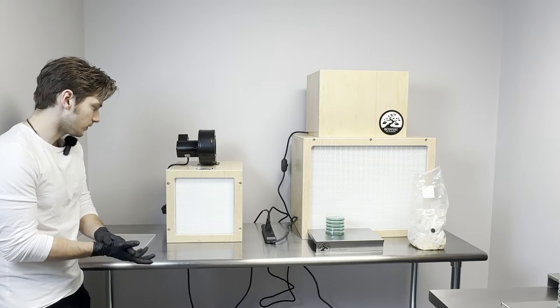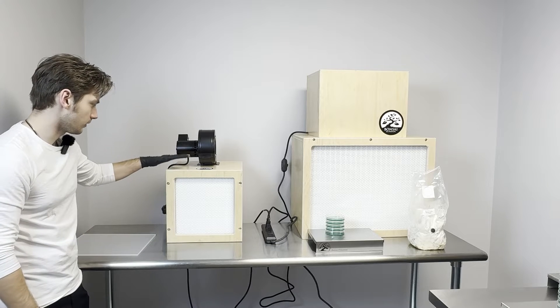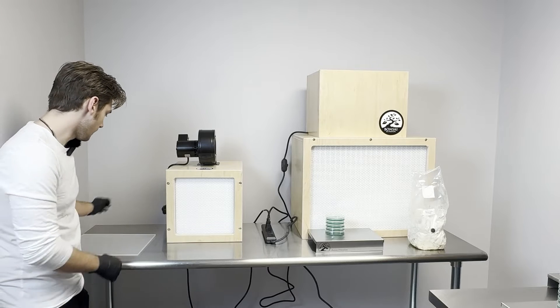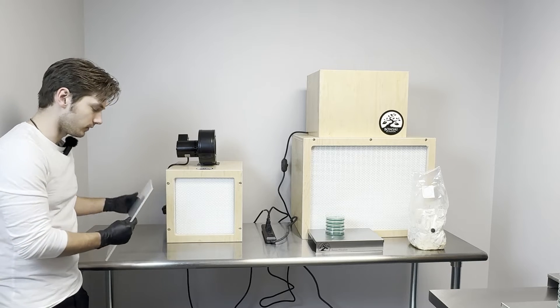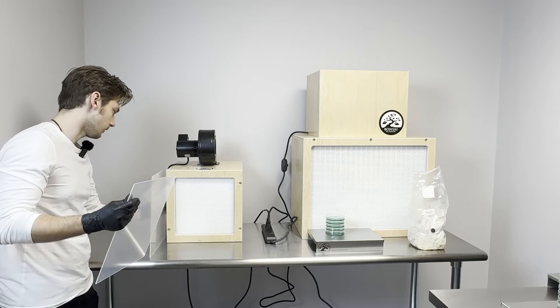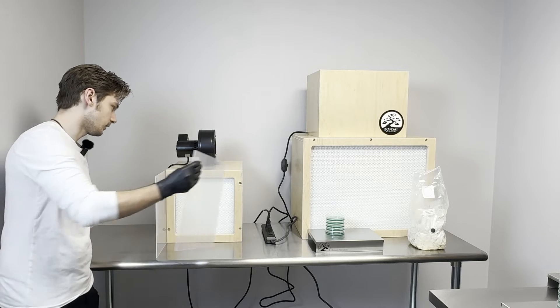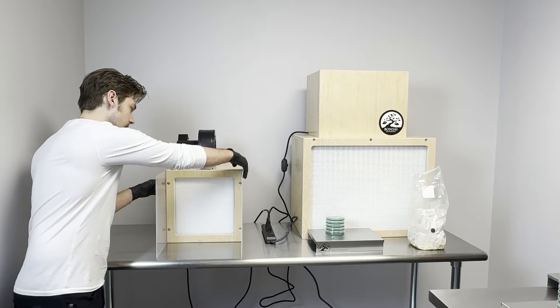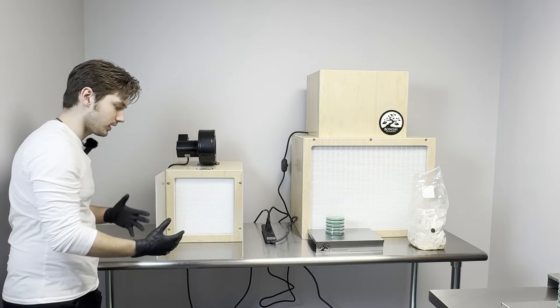If it's your first time using the flow hood, you'll want to go ahead and run it for at least 30 minutes to season the filter. And furthermore, if it's your first time using a flow hood at all, we recommend using the side buffers here. This just helps to train you in the parameters or the space that you can actually work within where everything will be sterile.